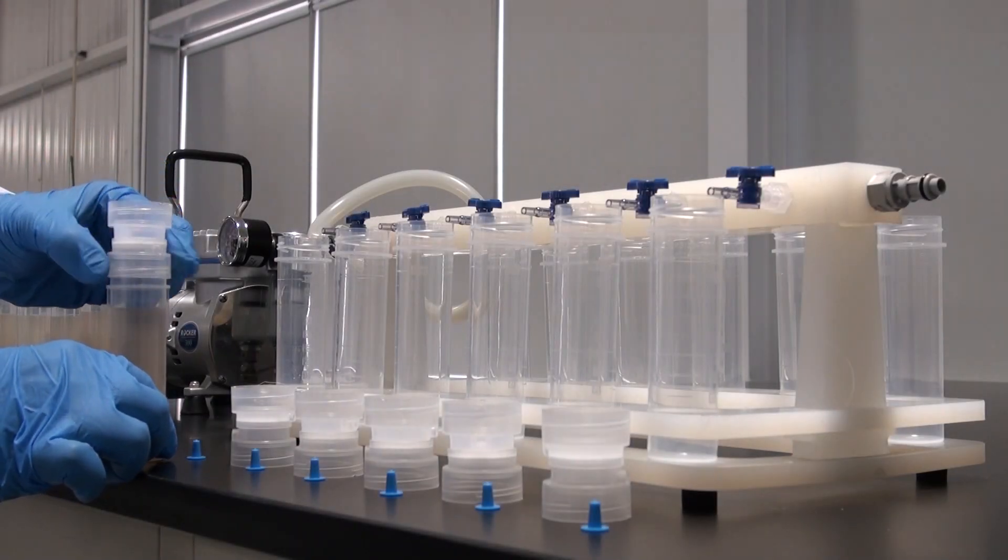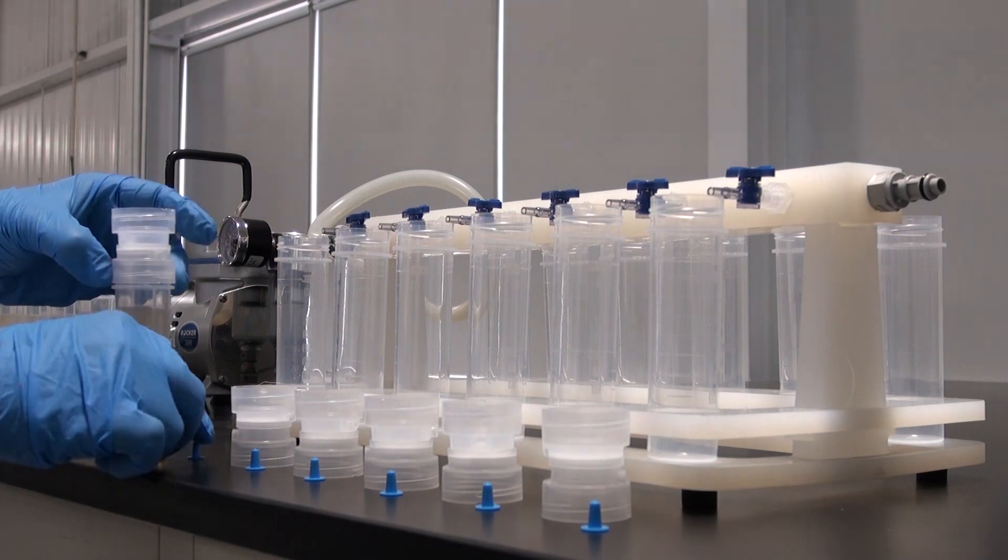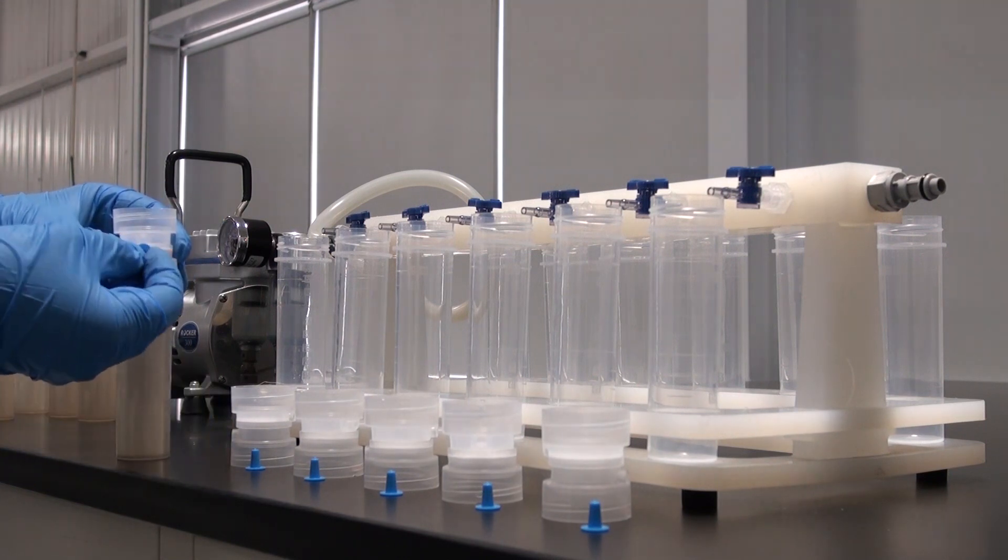Add the Digifilter to the digested Digitube sample and then thread a second Digitube to the other side of the Digifilter.